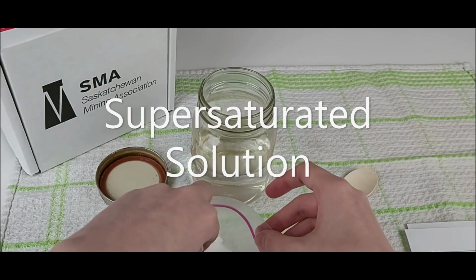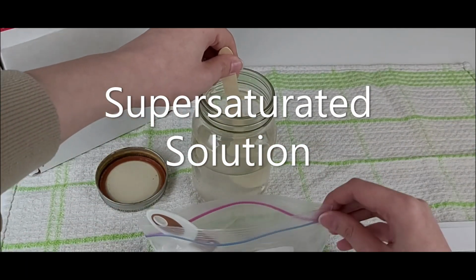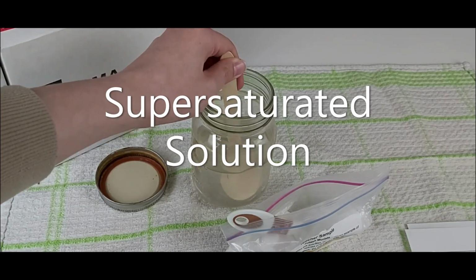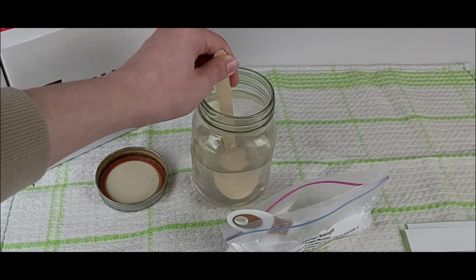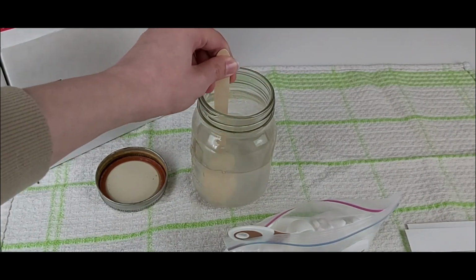There are 2 main ways to structure this lesson depending on the age of your learners. However, both involve creating a supersaturated solution. You can make a supersaturated solution in one of the 2 ways using the dissolved potash solution filtrate from the dissolving potash lesson and the Ziploc of granular potash included in the potash kit.